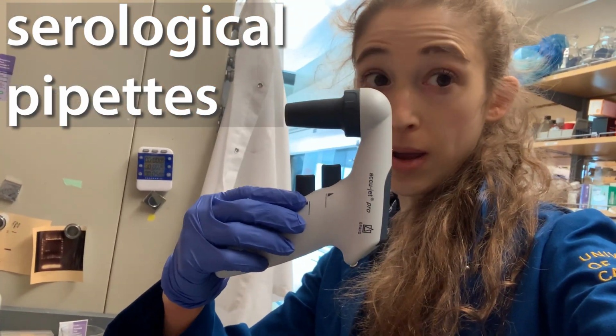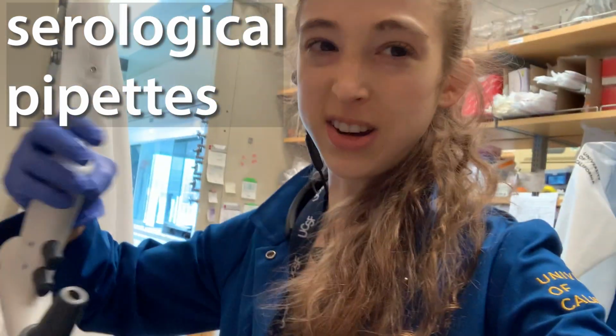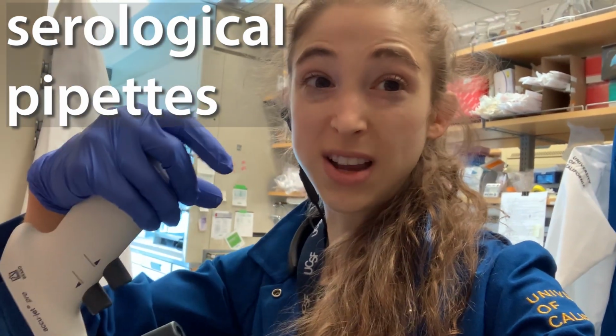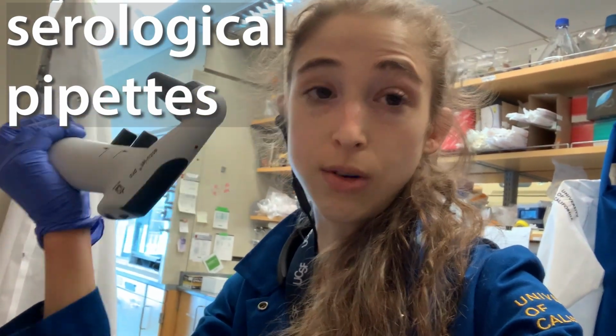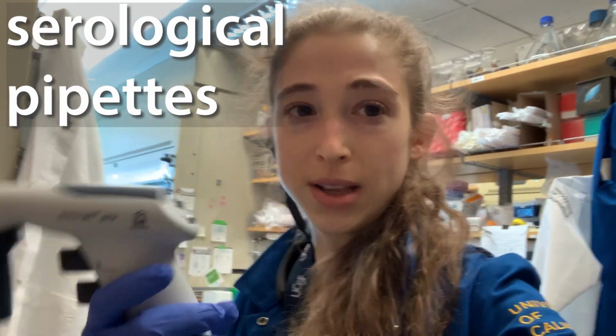Don't store your pipettes upside down. It might be easy when you're trying to get your hands free to open a tube to put it upside down, but then things can drip down into it. But you should not be reaching for that tube, because you should have everything ready to go by the time you grab this. So don't go upside down. Keep your pipettes right side up.